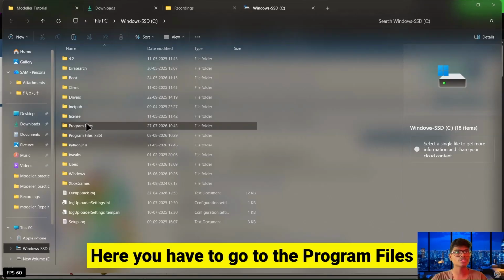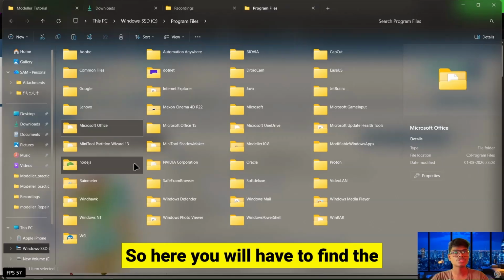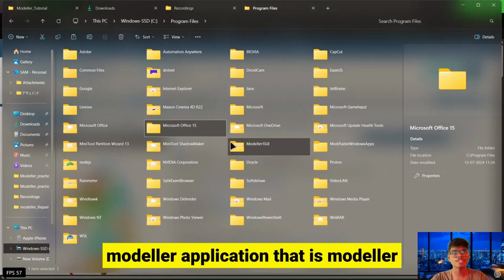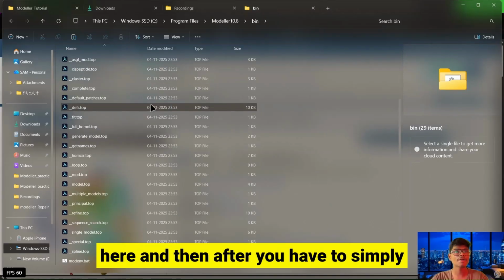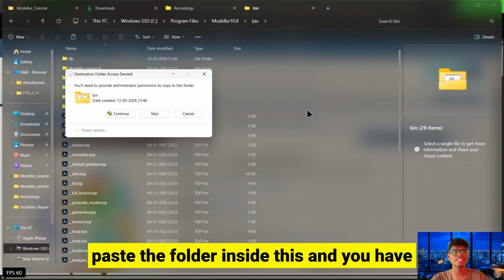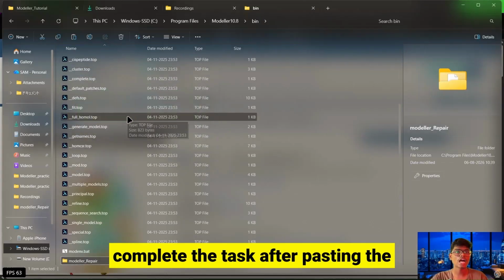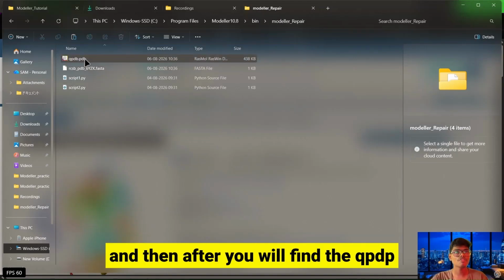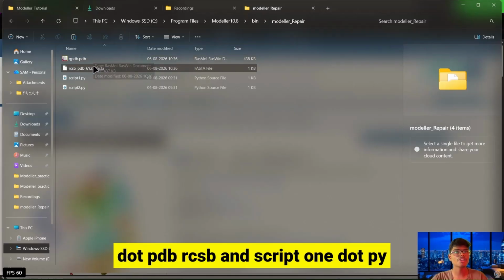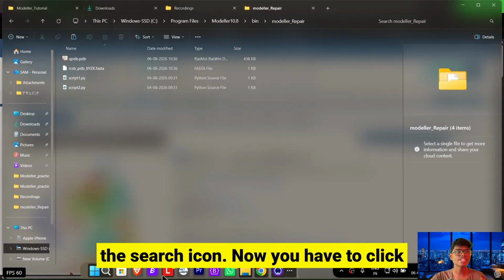Here you have to go to Program Files and search for the modeller. Find the modeller application, that is modeller 10.8, and you will find the bin section. Then simply paste the folder inside this, and give the administrator permission to complete the task. After pasting the folder here, click on the folder and you will find the qpdb.pdb, rcsb, script1.py and script2.py.